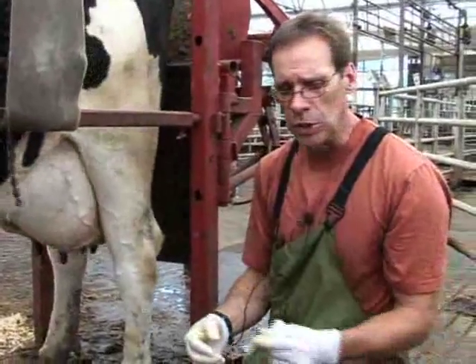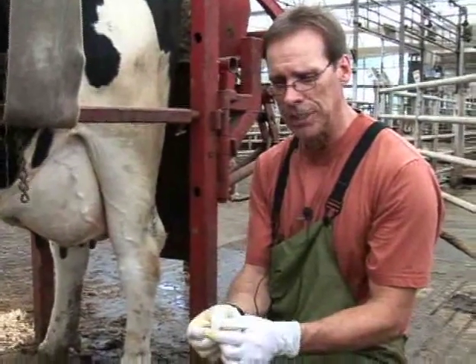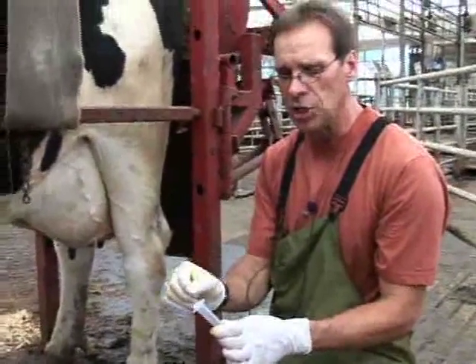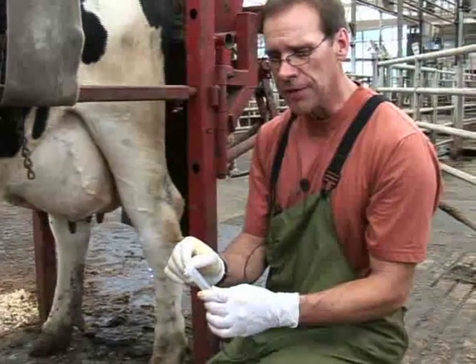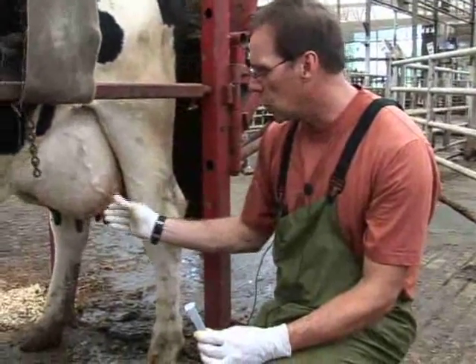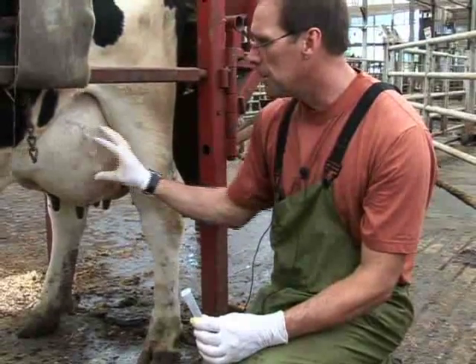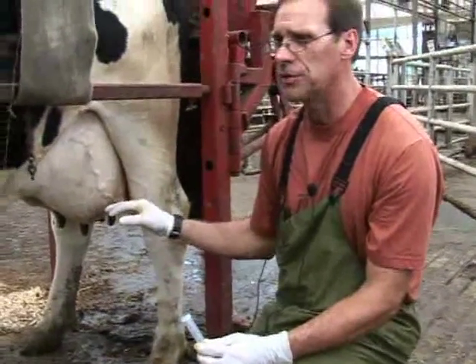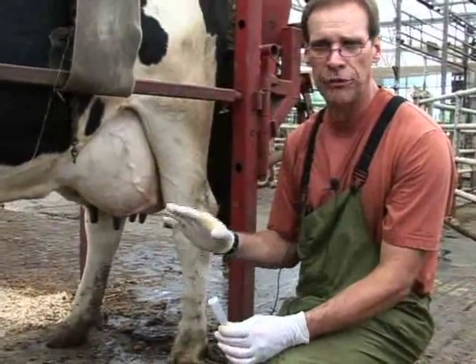We will use a plastic sample vial — a sterile tube — to collect our sample. We have to be careful when we open the tube that we do not touch any of the internal parts of the cap, as that could contaminate our vial. Also a very important part of taking this sample: every time you move the teat or the gland, particles — from hair to dust to all kinds of debris — can actually fall into your sample vial, so you want to be careful to avoid those.